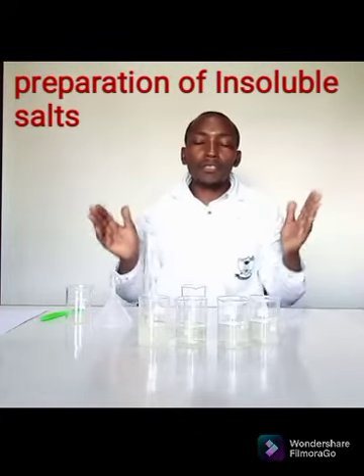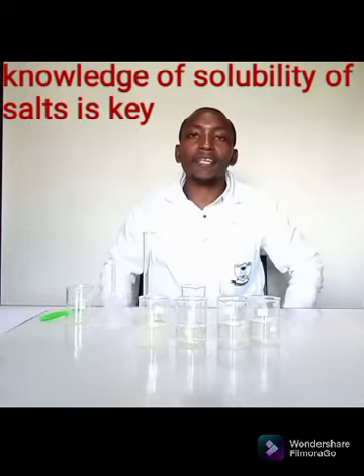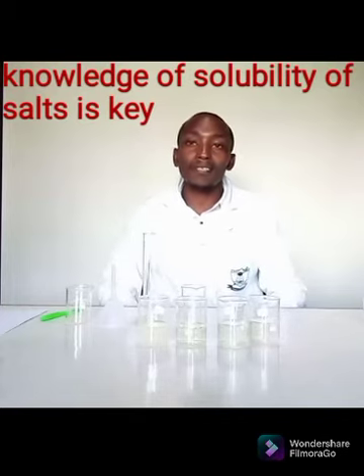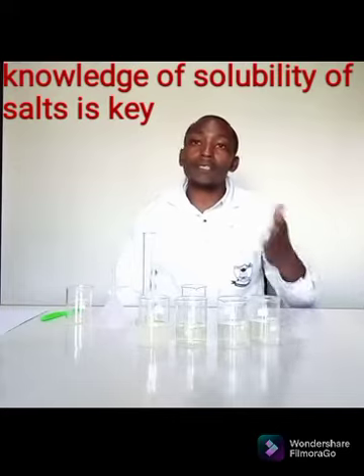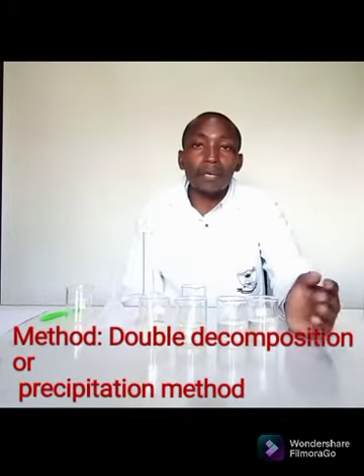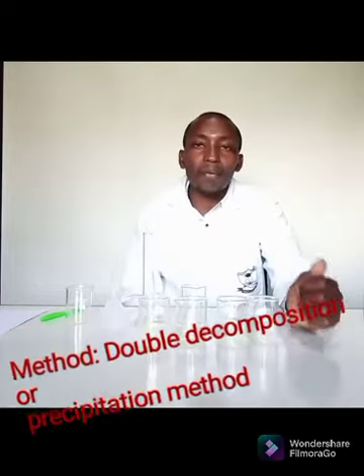Something you need to appreciate when you want to prepare salts: you must be very conversant with the solubility of salts. For you to choose the method, you need to know, is it a soluble salt or an insoluble salt? We are going to prepare insoluble salts using a method called the precipitation method. This precipitation method is otherwise called the double decomposition method.